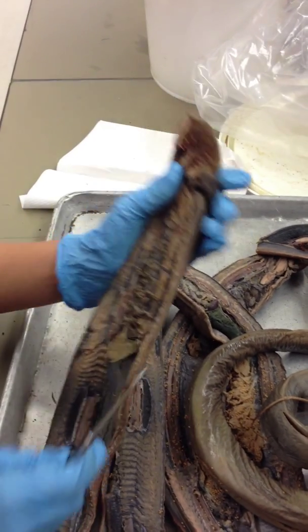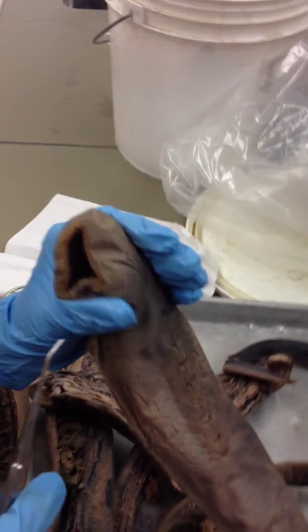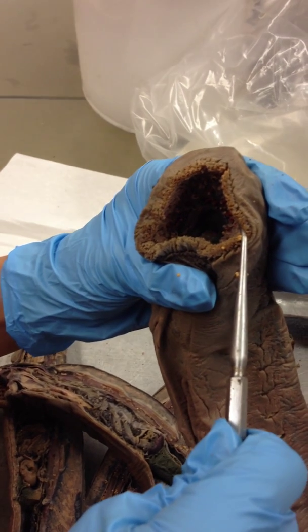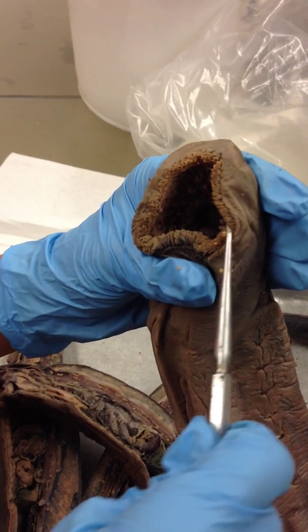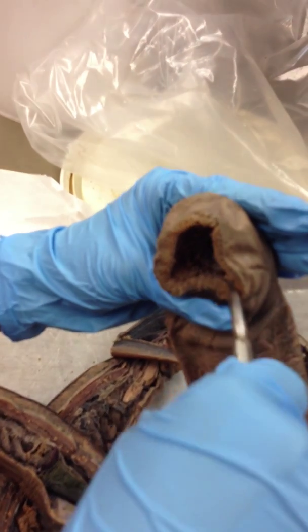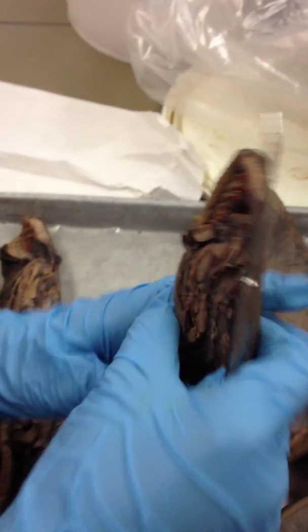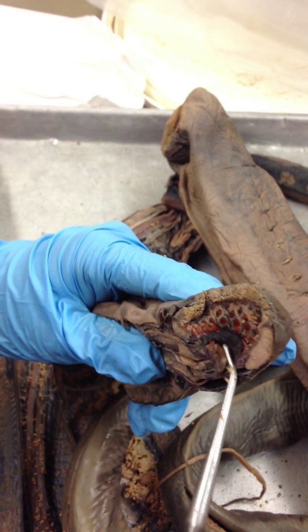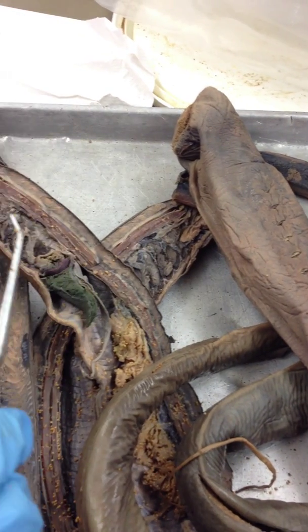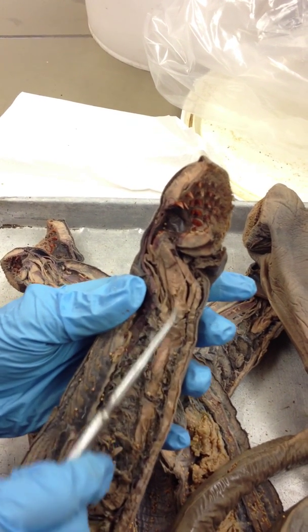Now we're going to start from the mouth. Inside the mouth is cornified with horny teeth, and you can see in there — there is a tongue. There's a better one over here; that is your tongue right there. And the muscle that moves the tongue is right here, this big fat thing.